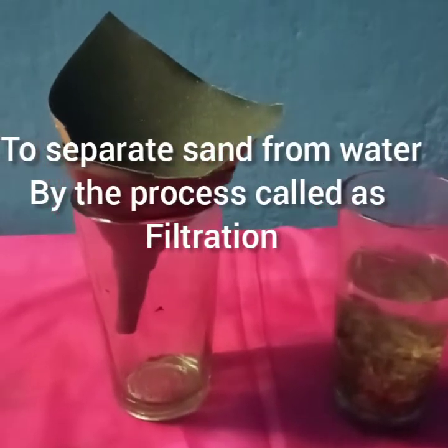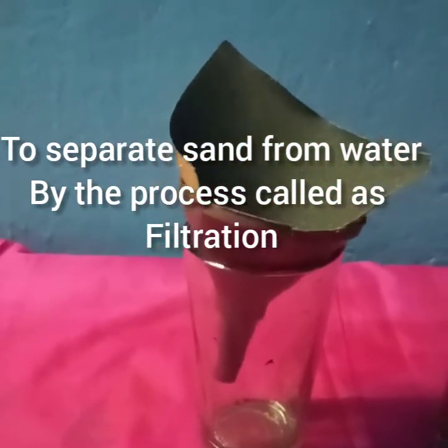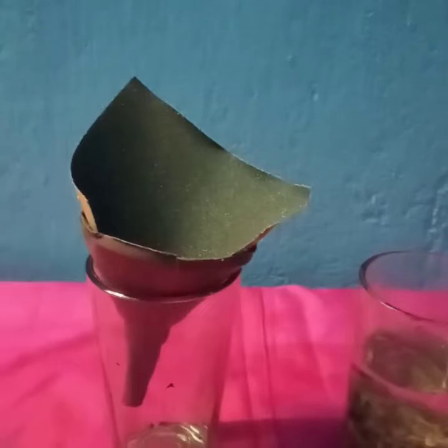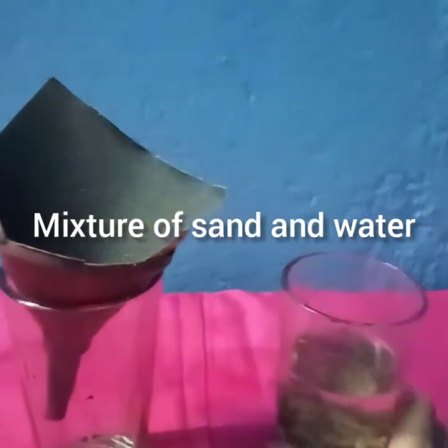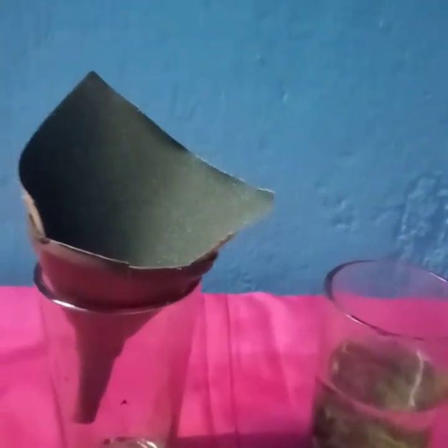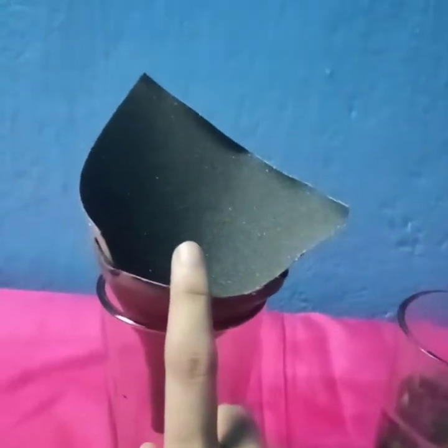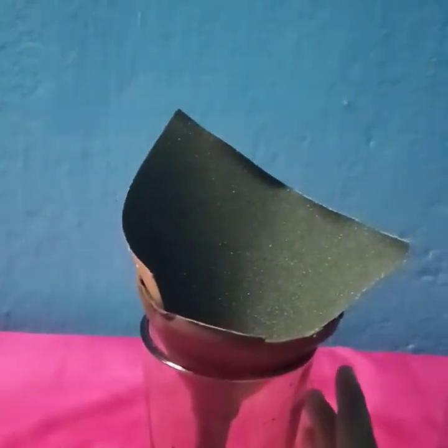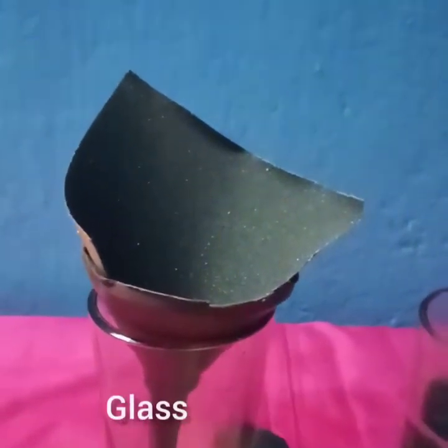The next activity which I have chosen is to separate sand from water by the process called filtration. In this method, we take a small beaker with a mixture of water and sand, which I have already prepared, and we will be taking filter paper. Instead of filter paper, I have taken sand paper, and we will be fixing this funnel. This is a funnel. We will be fixing it over the conical flask. I don't have conical flasks, so instead I have taken this glass.